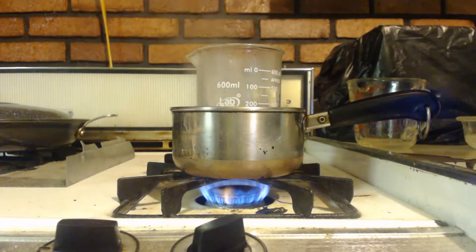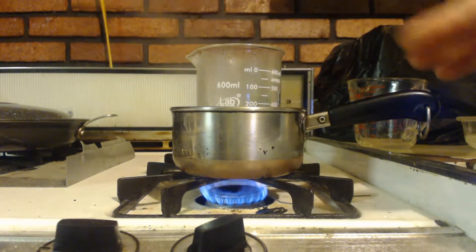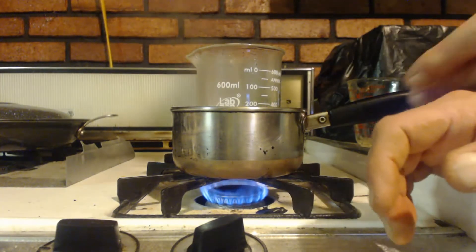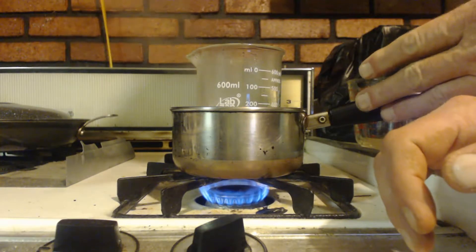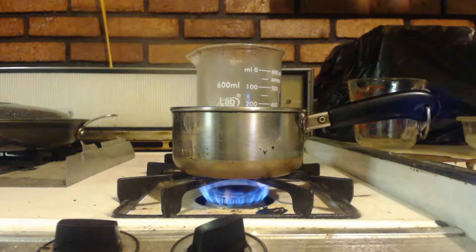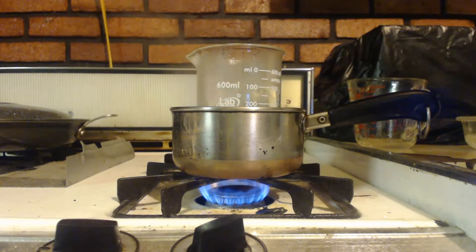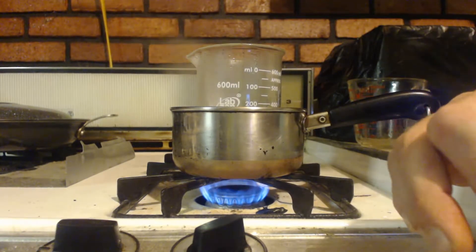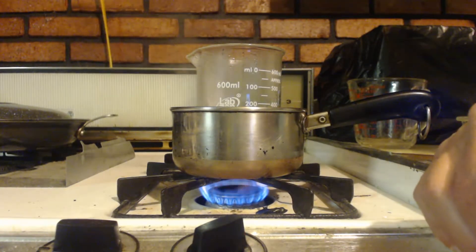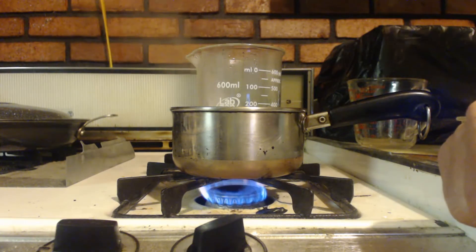Normally, since it's boiling and getting some crystals, you take this off. But there isn't much contamination in there. I'm gonna let it boil even more away. I want to leave at least some water in there because it is yellow, but I want to boil it down more than I normally would for recrystallization.